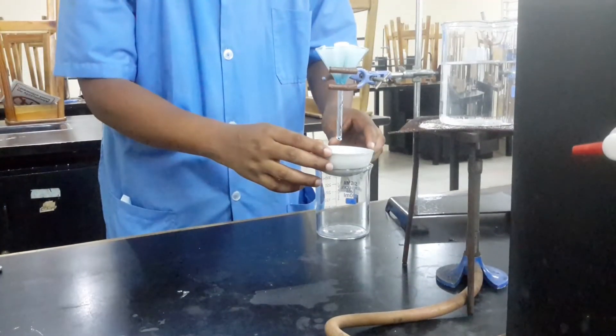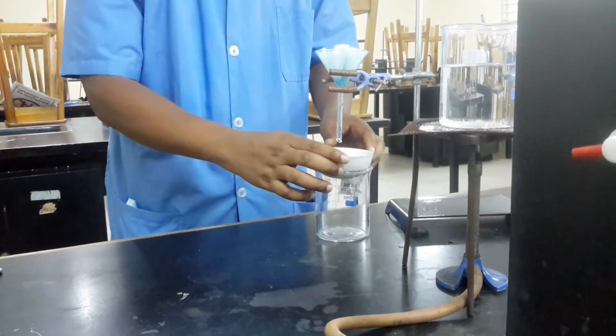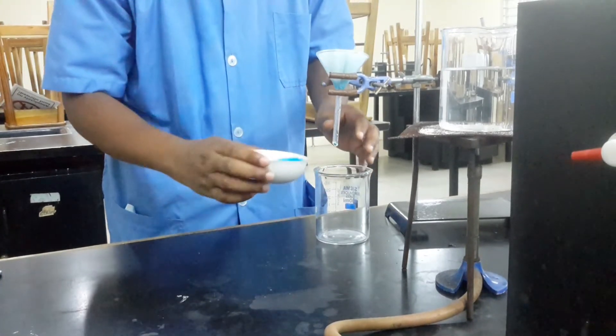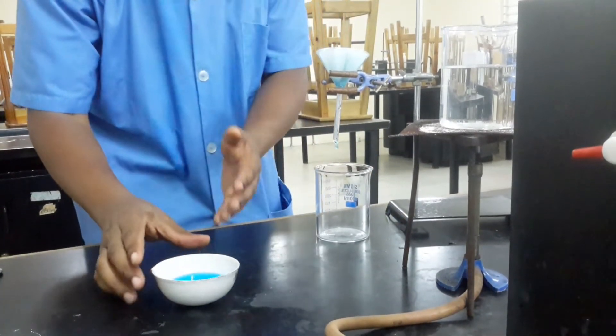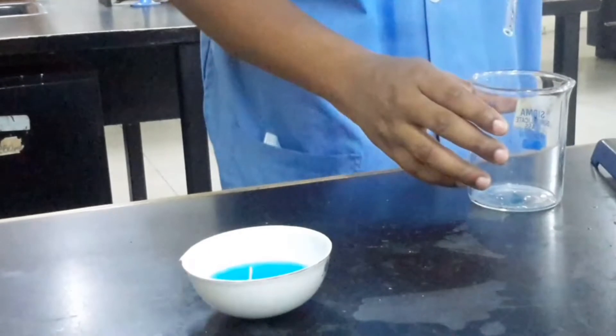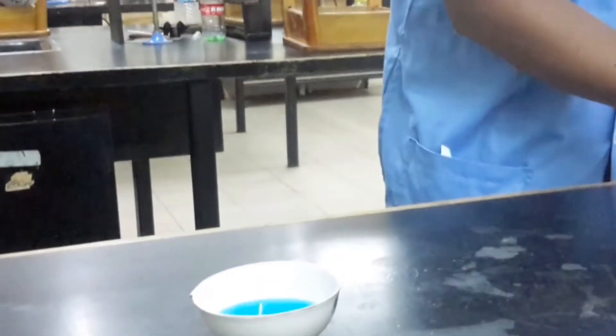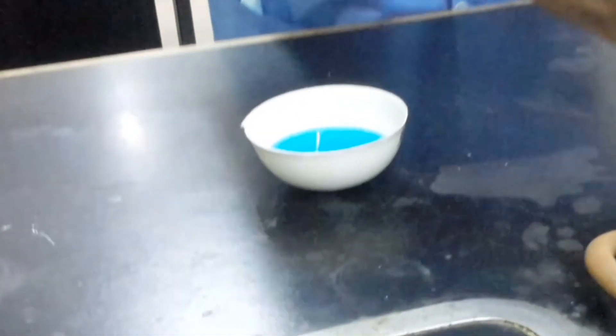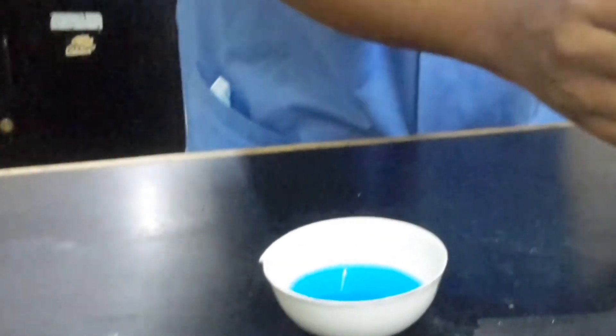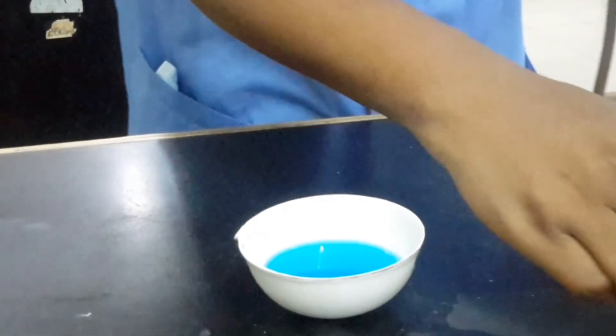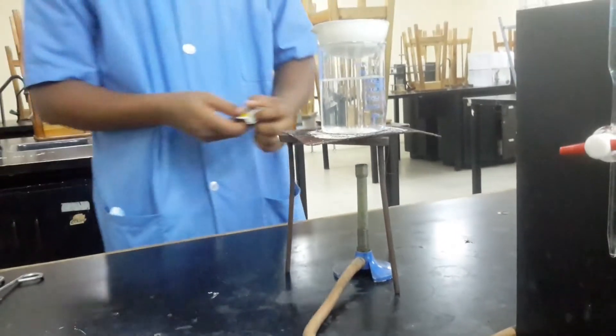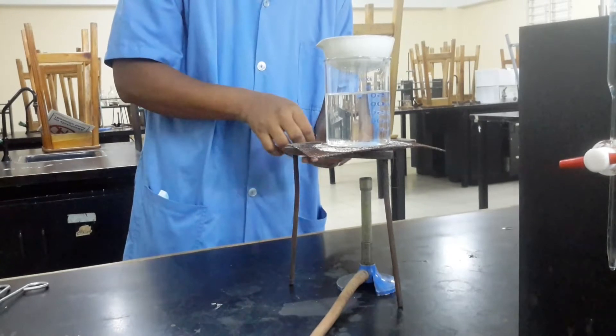Filtration is finished so we have our copper sulfate solution. We need to evaporate this. We're going to heat it gently on a water bath.